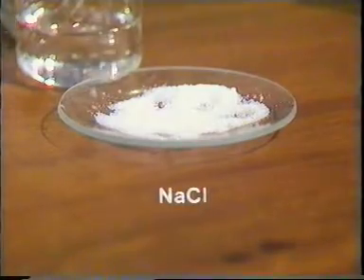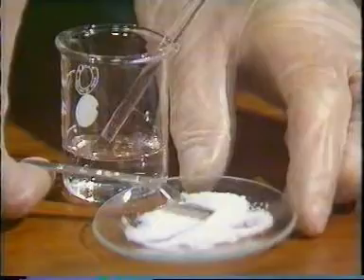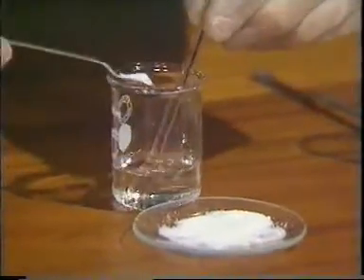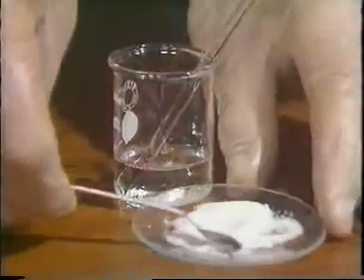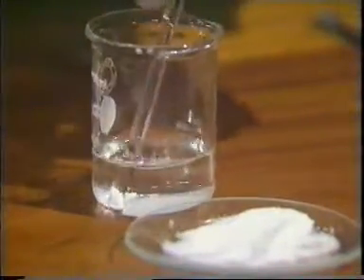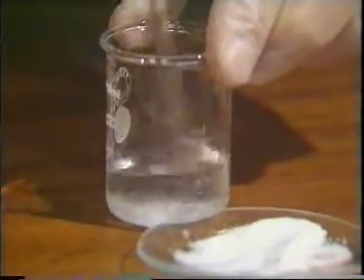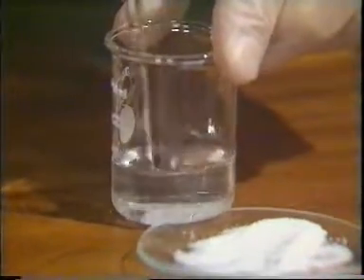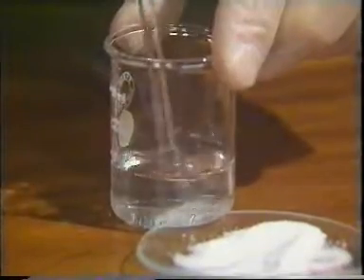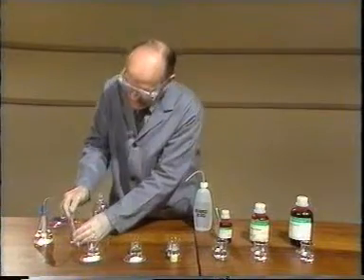First, sodium chloride. As you can see, this is a white solid. Now if I put some in the water and stir, nothing very much seems to be happening. No sign of a reaction. The solid appears to be dissolving quietly. But I can check this by looking at the temperature change.